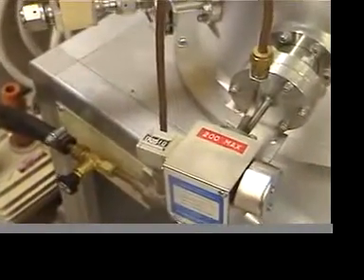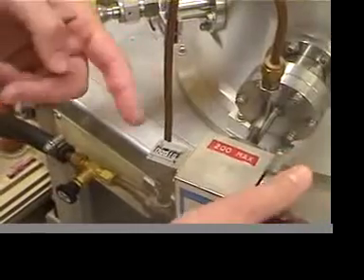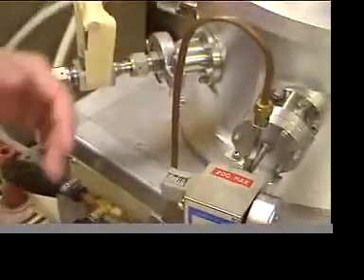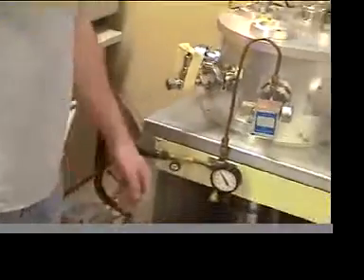As you can see right here, when this number reads 10, it's closed. If you turn it this way and it goes up to 40, it's open. That's the range you want to keep it in so you don't have damage to your equipment.